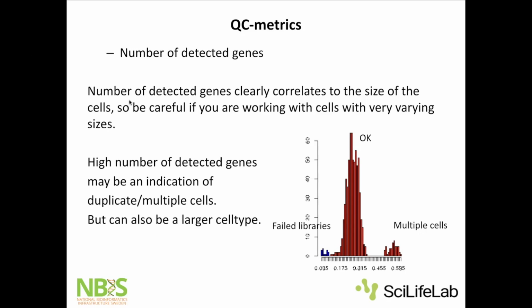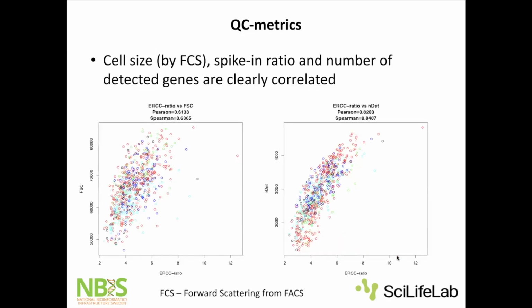And this is a mock experiment where they sorted multiple cells in SmartSeq data in the same well versus a single cell, and then we had some clearly failed libraries. So just looking at the distribution, you can quite often see the doublets having higher numbers and the failed libraries having lower numbers of genes. But it's tricky because these could be two very distinct cell types having very different numbers of genes, but it shouldn't be this distinct, perhaps.